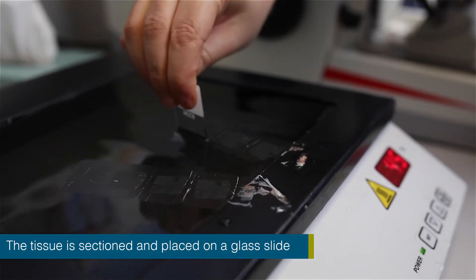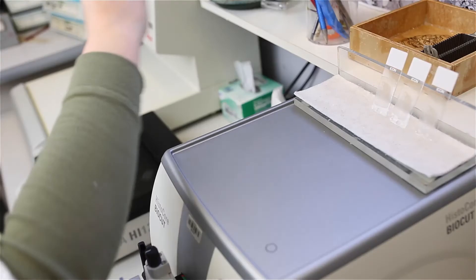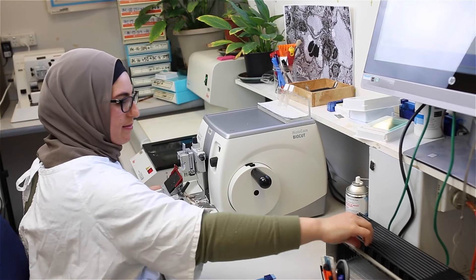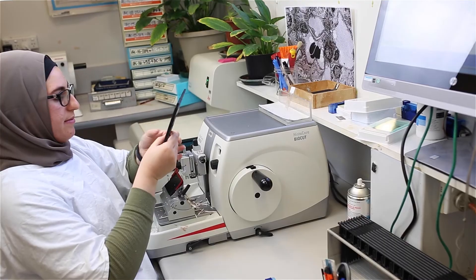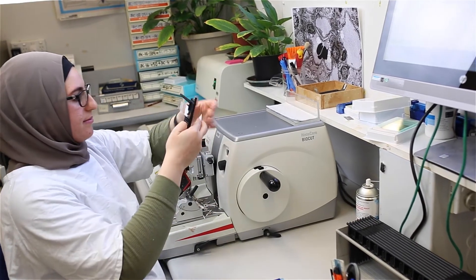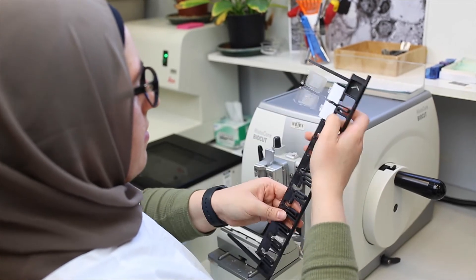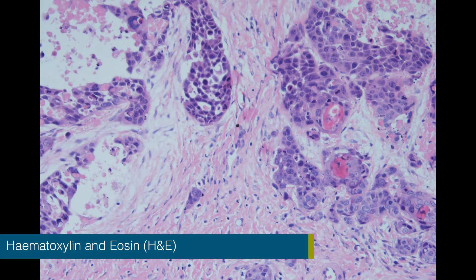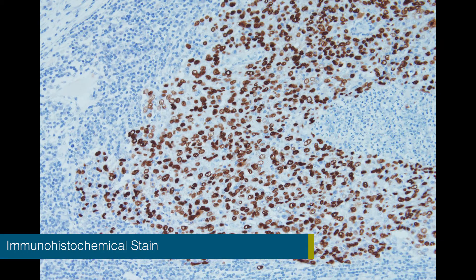The usual stain for light microscopic examination is known as the hematoxylin and eosin stain, which provides the basic morphological examination of the tissue. However, plain sections can also be stained with other special stains, immunohistochemical stains, or in-situ hybridisation testing depending upon the required microscopic examination.